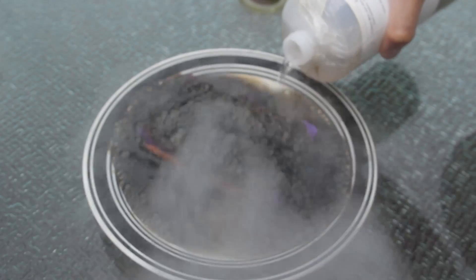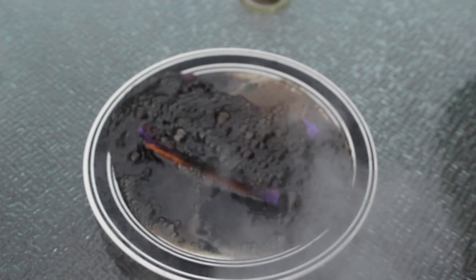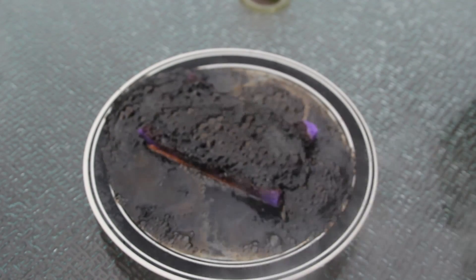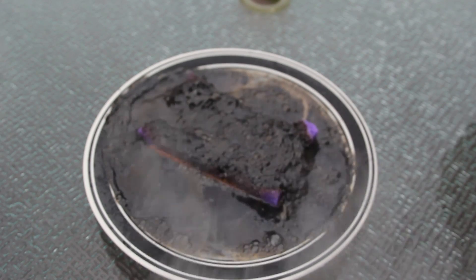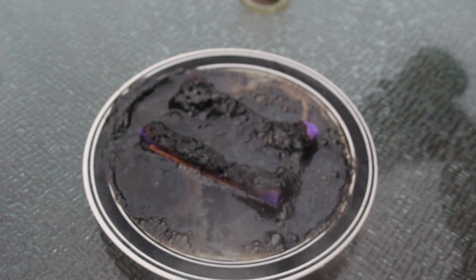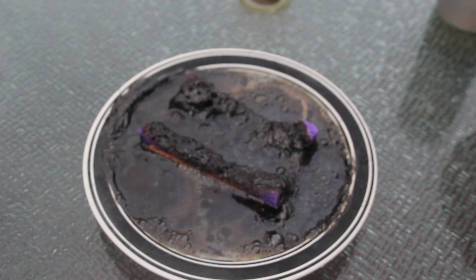Ooh, this sounds pretty crazy, huh? It just blew through it so easily. Why does that work? How does it work scientifically? Why is it actually not burning the bottle, but the sponges got burned through so easily?